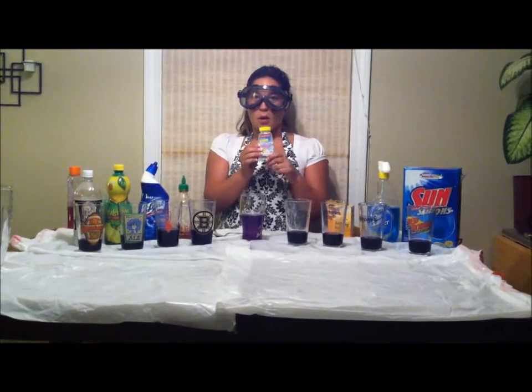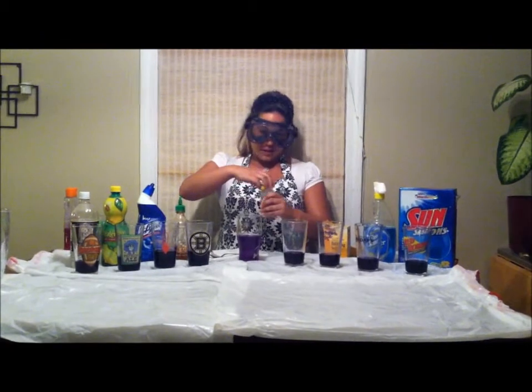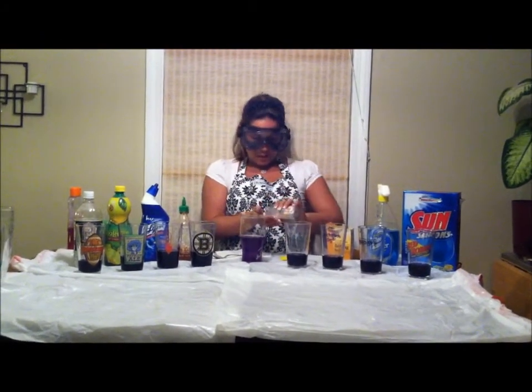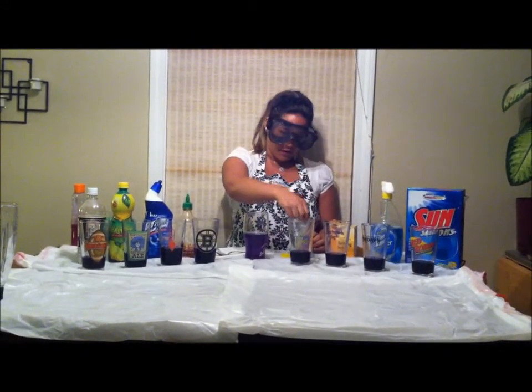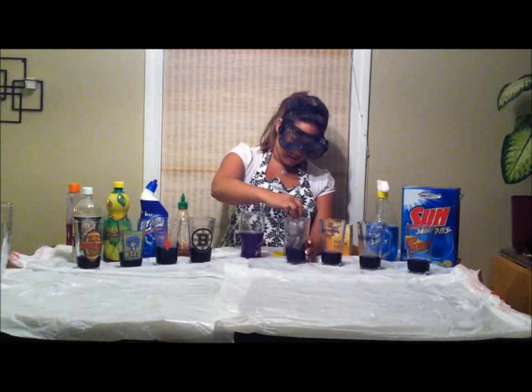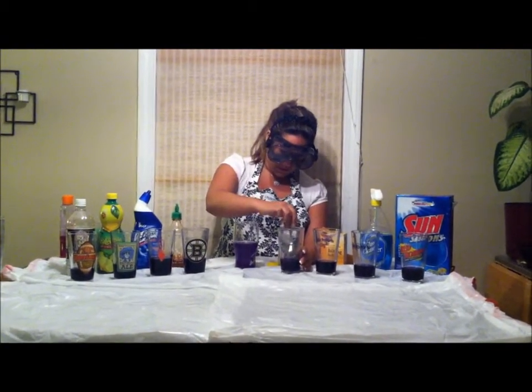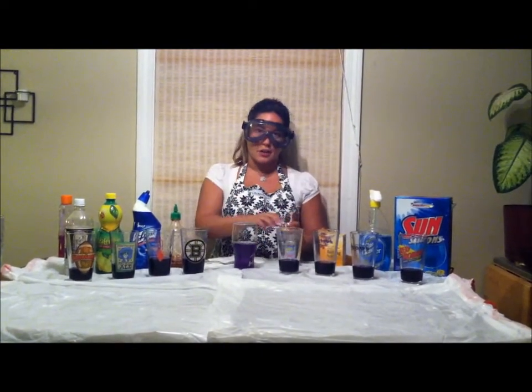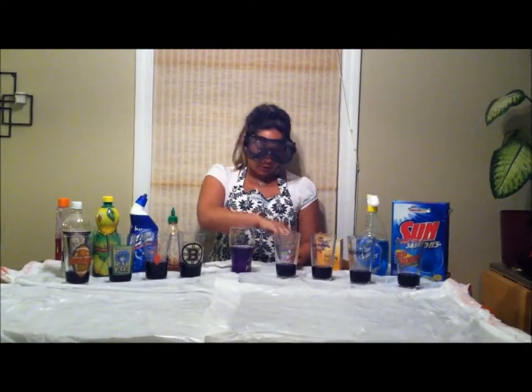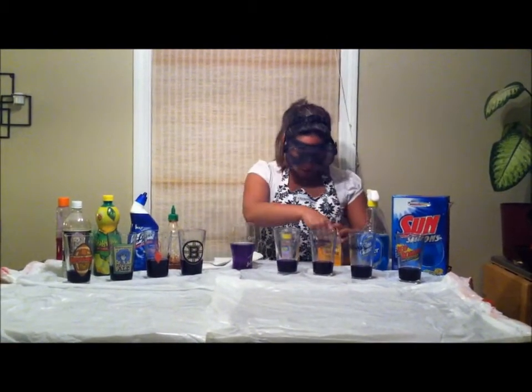We have our old antacid, for those of you that love to eat some acidic food and get heartburn from time to time. Pop one of these and it dilutes some of the stomach acid. So we're going to put 3 of them in here. Stir it up a little bit, see what we get. I think you'll see a good change in a few minutes after we just let them sit for a little while. So let's just get them all set up here, and then we'll wait a few minutes and see what kind of colors we get.